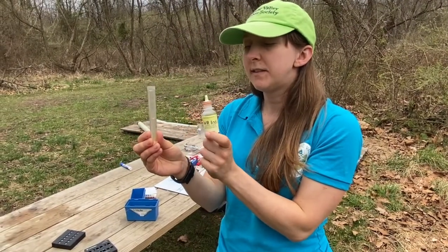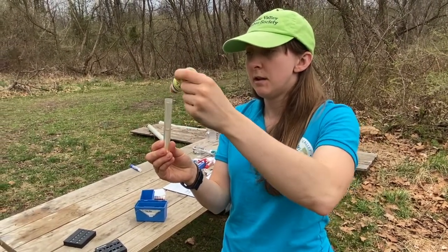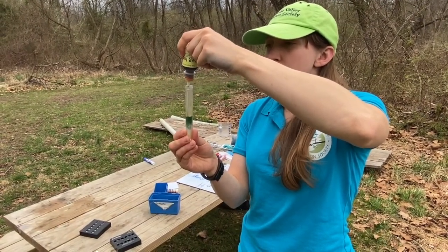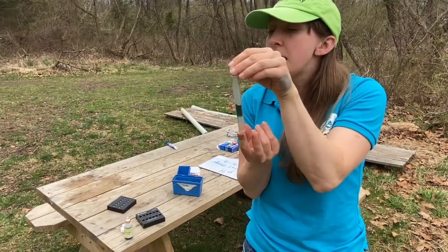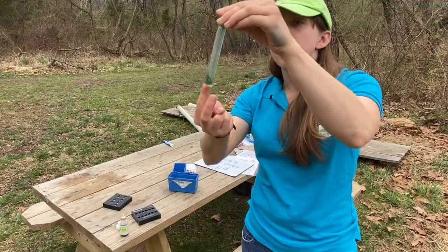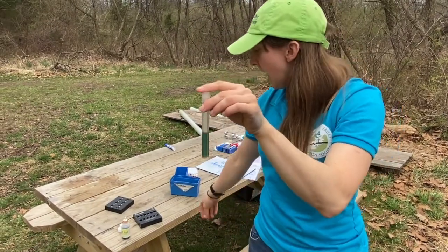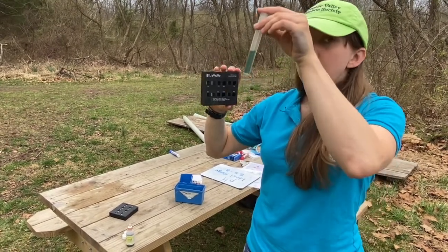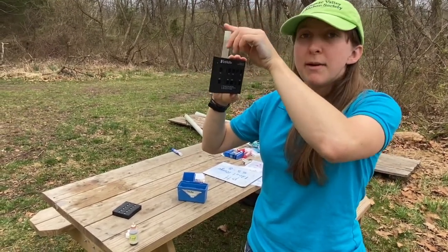I'm going to add 10 drops of this indicator solution — one, two, three, four, five, six, seven, eight, nine, ten. I'm not going to shake it, but I'm going to nicely flip it upside down over and over again, and as you can see it is nicely mixed.